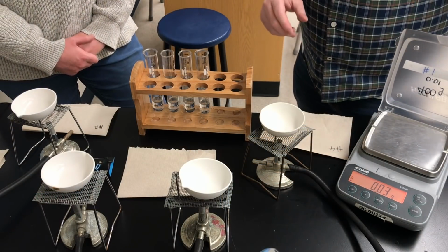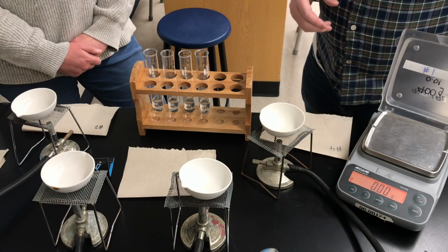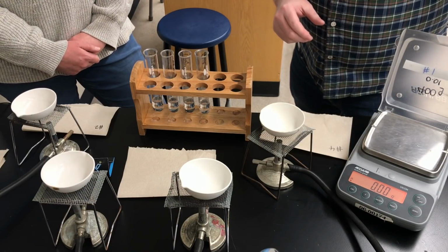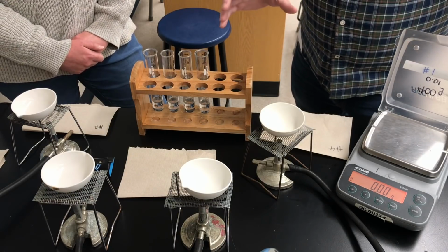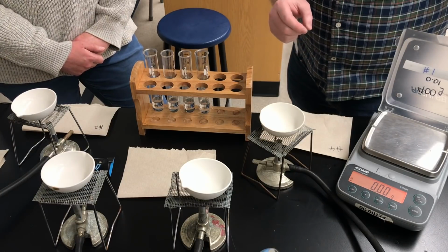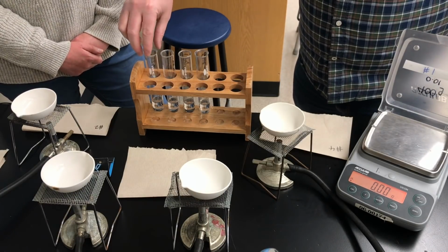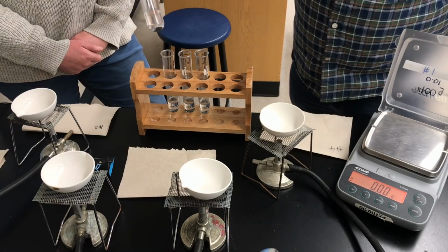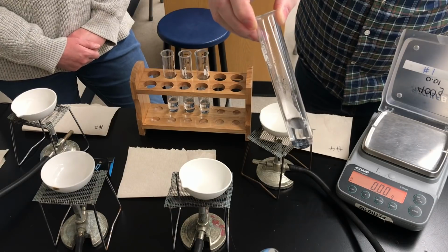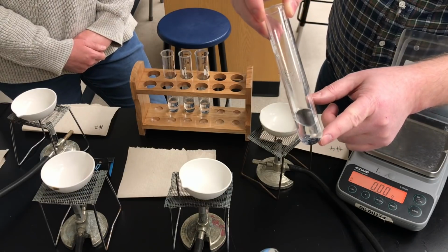All right, so it's now day 2 of our synthesis of zinc chloride experiment, and I'm joined today by my teaching partner, Miss Watts, and we're going to conduct the second part of the experiment for you. Keep in mind that part of this experiment is aimed at just grade 9 advanced science students, while part of this is also aimed at grade 11 chemistry students. So we've got here our test tubes that were left over the weekend, and you can see that the chemical reaction has stopped. There's no more bubbling, and you might be able to see there's some pieces of zinc metal left at the bottom of the test tube.